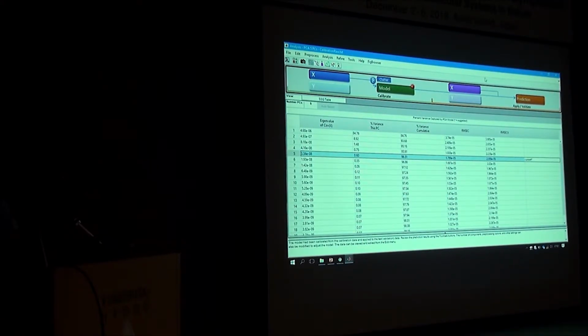This is very important. So you do the same orthogonality, based on the calibration set. So it knows nothing about the new set. It applies the same orthogonalization that was modeled in the calibration step. So that is what you can then use to predict the competition data.